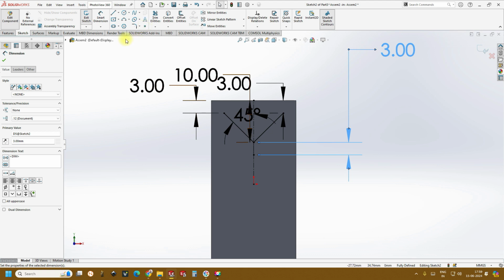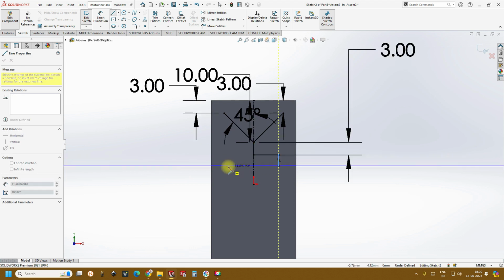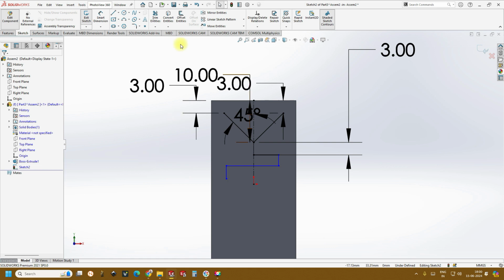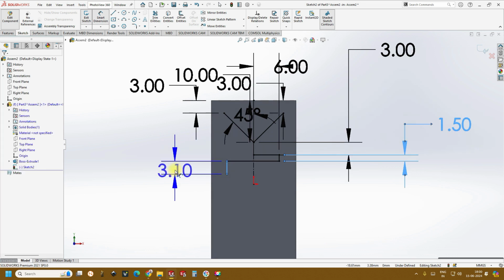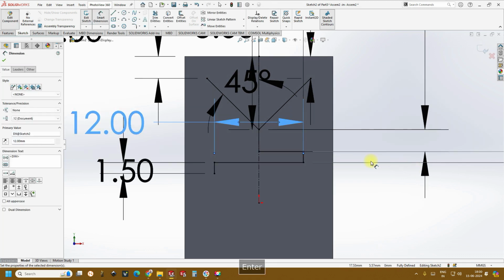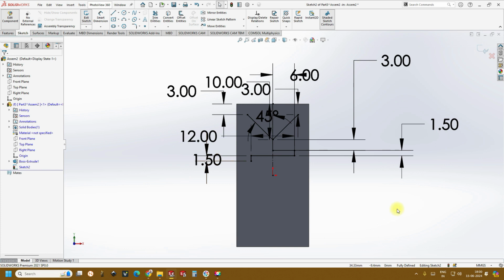The easiest way to learn is to just create the lines, and don't take a line and create multiple lines. It creates a lot of mess. So that is the reason, just create a line here, the half line followed by one line and another line. Okay, if you want this line you can create it, but don't do it. Okay, let's create and keep it here, select. Now let's give the dimensions to this, somewhere close to 6 mm, and this we'll keep at 1.5 mm, and this is also 1.5 mm, and if it is 6 then we can give it as 12 mm, just to make symmetry of the serpentine channels. So once it is done, we are almost done.